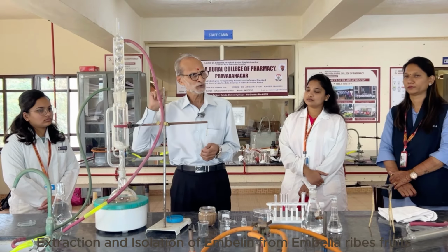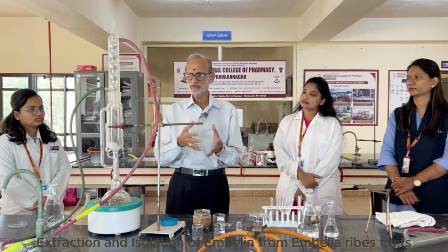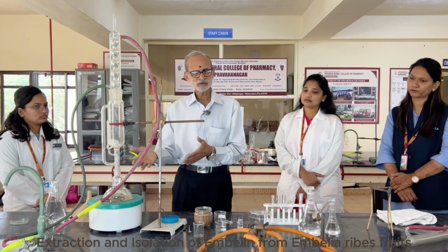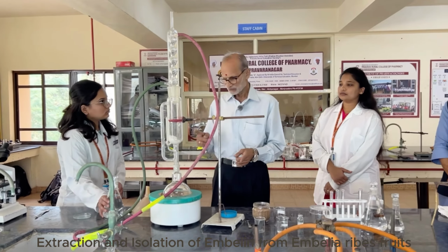remain in the solution. So here is a case where normally otherwise we say like dissolves like, that means whatever is soluble in which solvent, that solvent should be used. But in this case, we are using contrary to that. We are going to use a solvent in which it is less soluble or not soluble. Clear? All right. So you will be loading this.